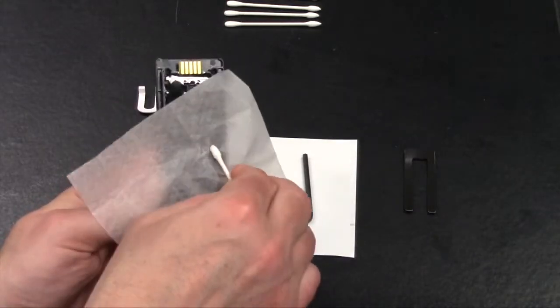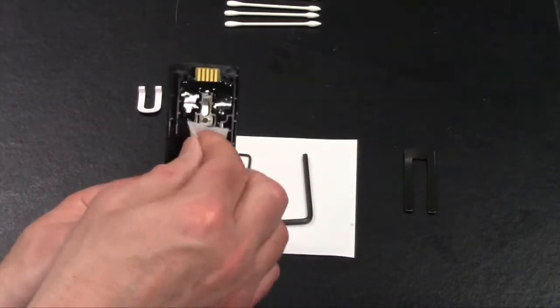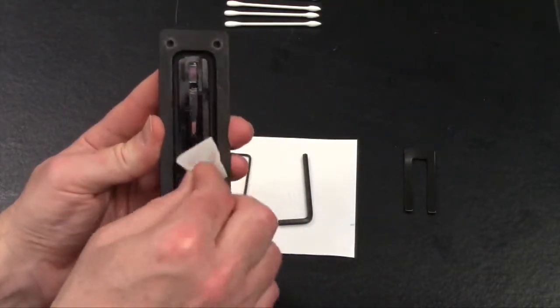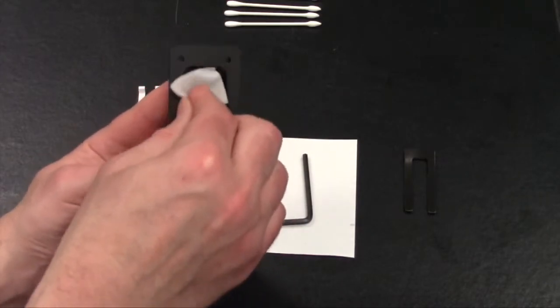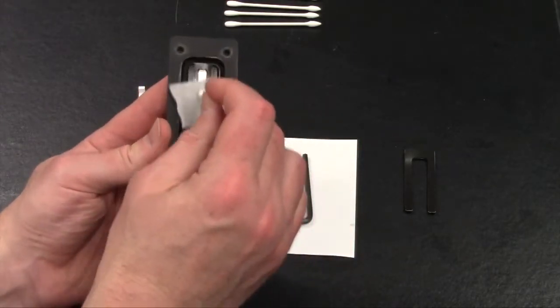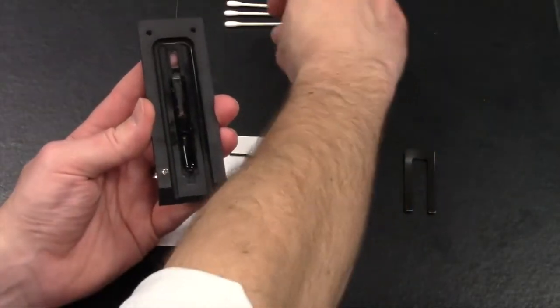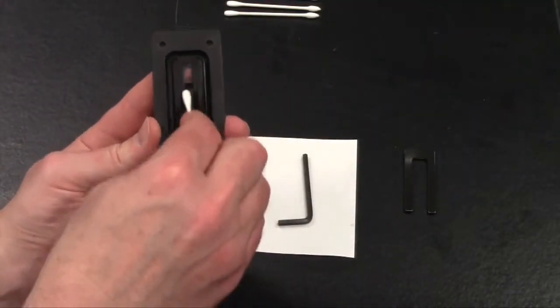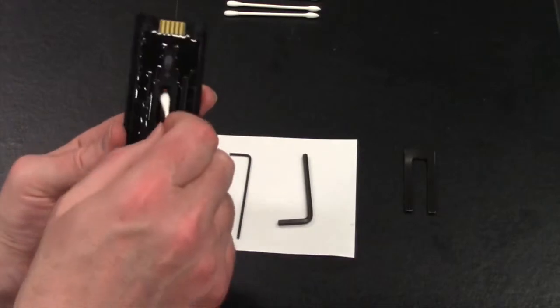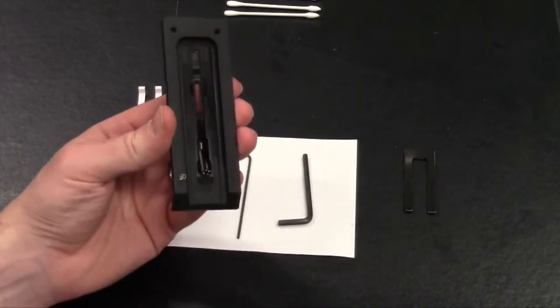Once you're done with the soap towelette, the number 1 towelette, you can use the second alcohol wipe, follow that up and clean any soap residue that was left. Again, do your best to remove any residue or any contamination that's present, and use the provided swab to help get into the different areas of the lens. Once done, you can use a new dry swab and dry off the lens area to remove any dried residue or wet residue. We want to make sure this is dry and there's no dried residue left on the lens.